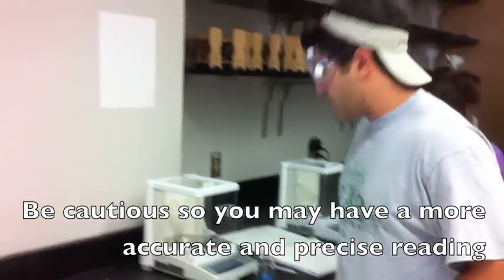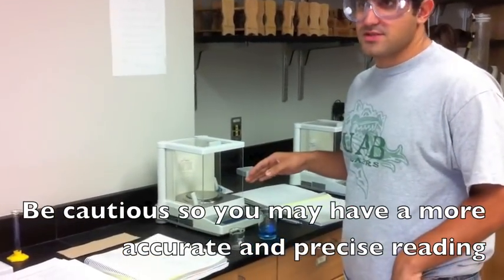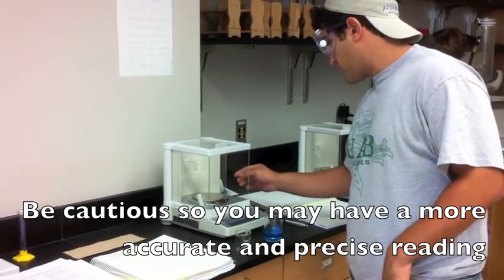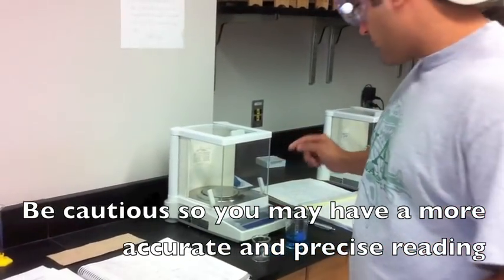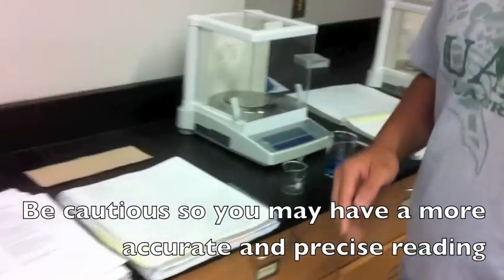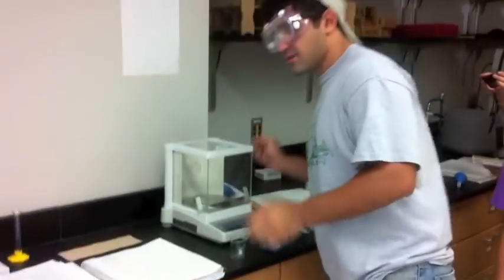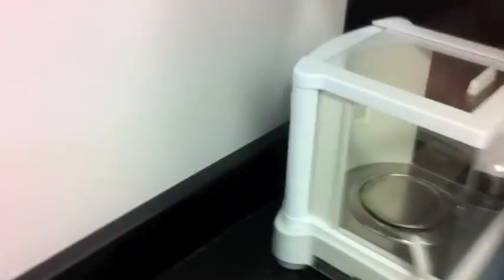The whole time when you're doing this you cannot move this at all. You have to make sure the balance is completely clean before you start. Make sure you also tare it right before you start, and by checking the back you have to make sure the balance is level.